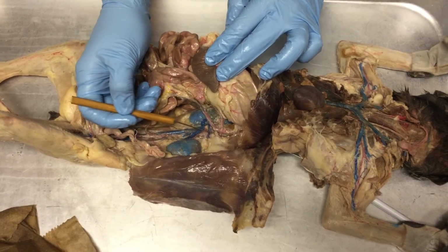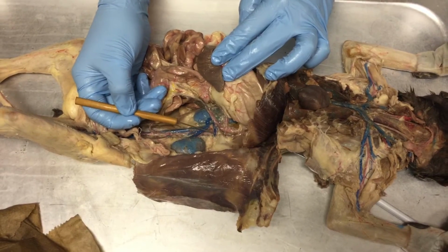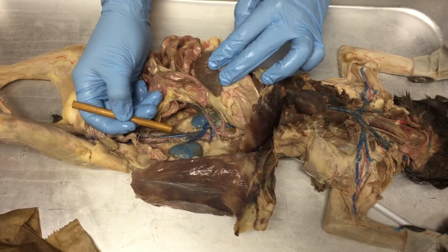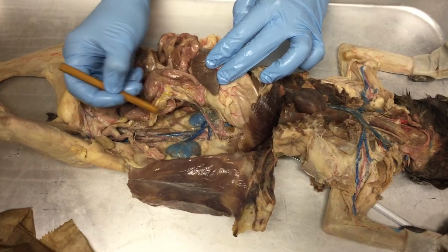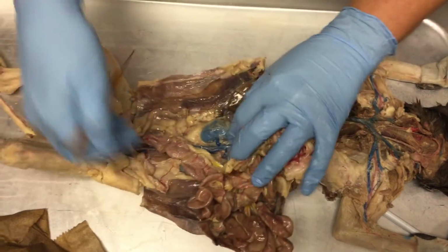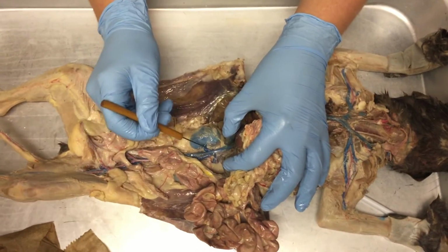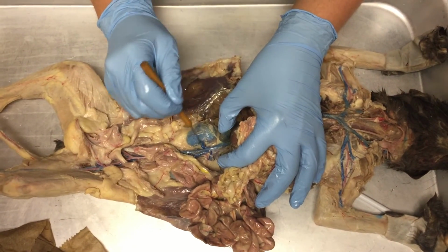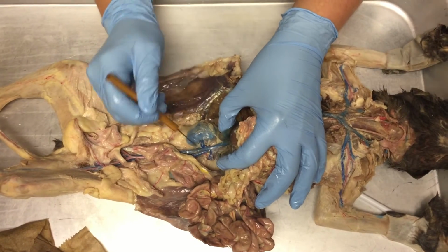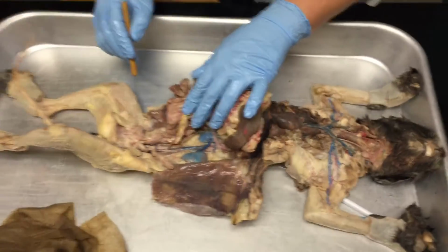And there is an artery too, you just can't see it very well. But this would be the adrenolumbar vein, coming from the adrenal gland back to the inferior vena cava. Here, so if we switch sides, you'll be able to see this is the right renal vein. And below it, you see the right renal artery, okay? All right. What else?